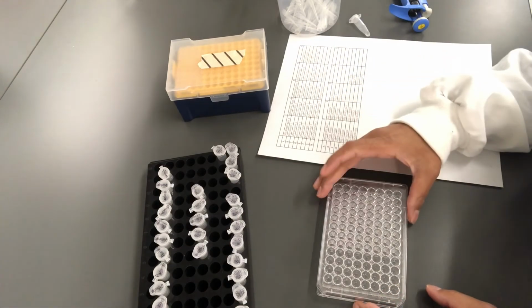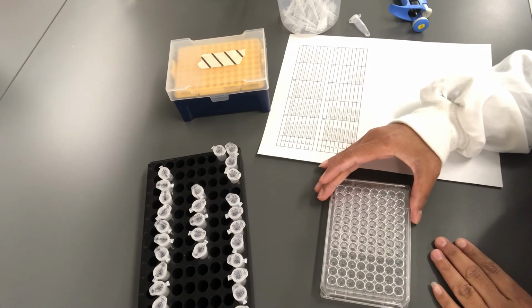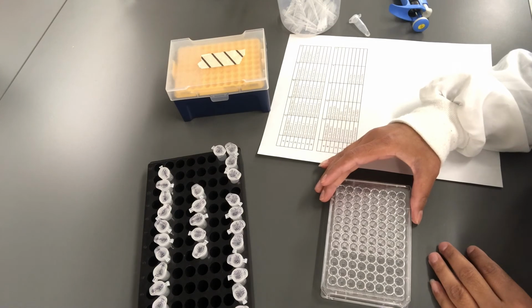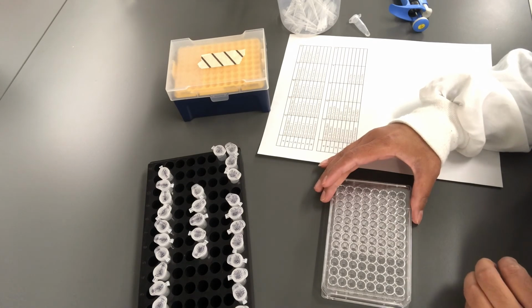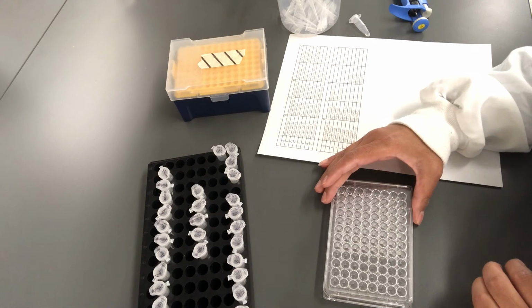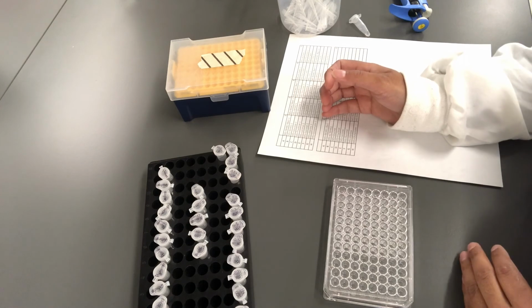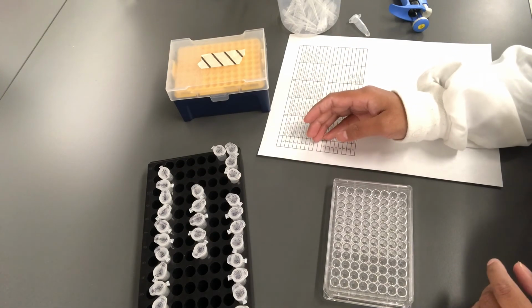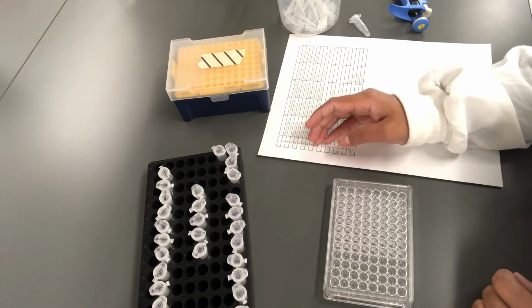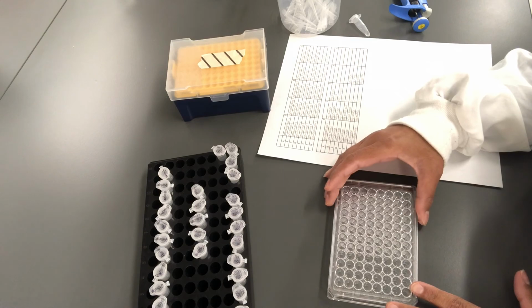After adding media and culture into the 96 well plate, I'm done, and the plate is ready to load into the plate reader, where it will measure the absorbance of the bacterial culture, bacterial growth at 600 nanometers, and you'll be provided with the data in coming weeks to analyze, where you'll calculate different things. After you're done with this much, you're good to go from the lab.